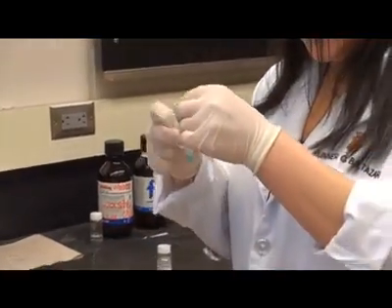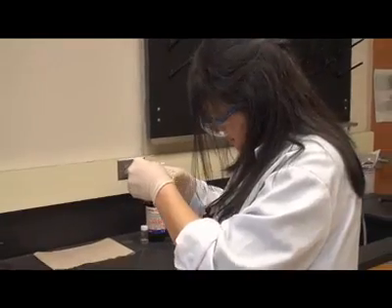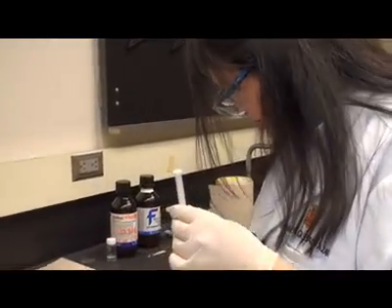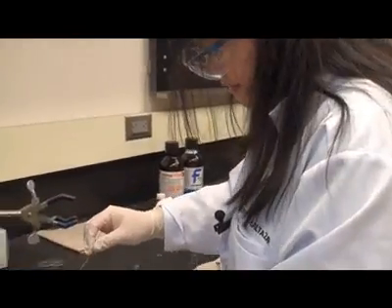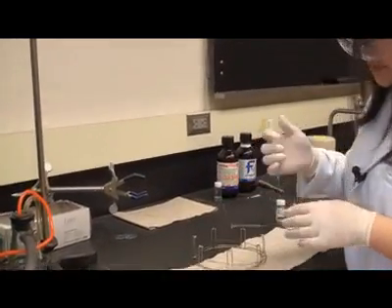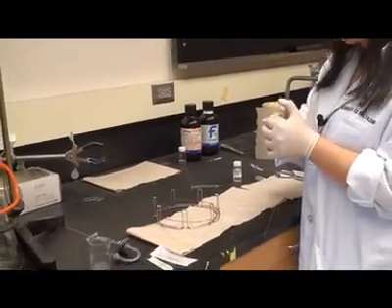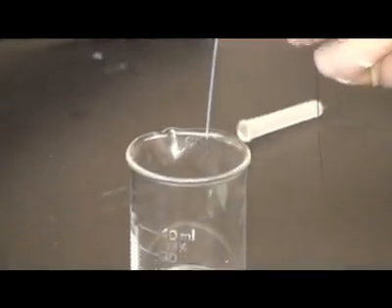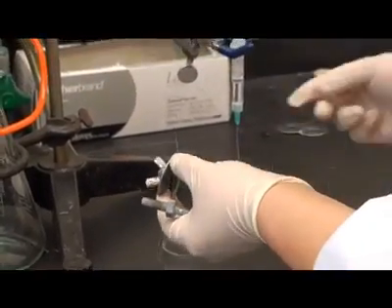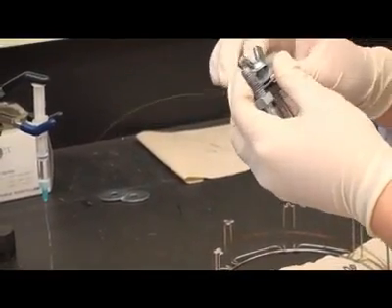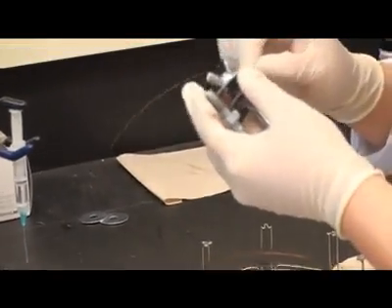We want to tap this to make sure to get rid of any air bubbles. And we want this to go over here. So we will flush the coating solution through the column for a few milliliters. The coating solution is being flushed through the column and now we can begin to seal the column. Placement is crucial here because you don't want to break the plastic tubing but you want to be able to seal it.